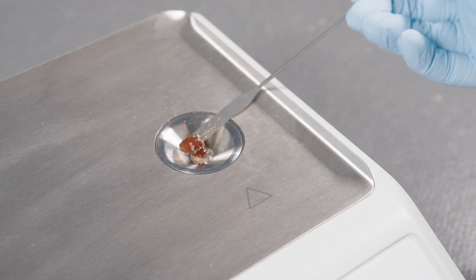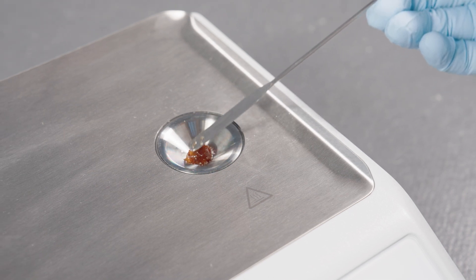To measure viscous samples, select a method, enter a sample name, and apply the sample using a spatula.